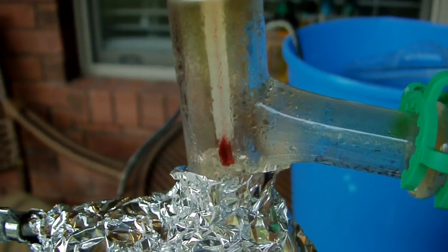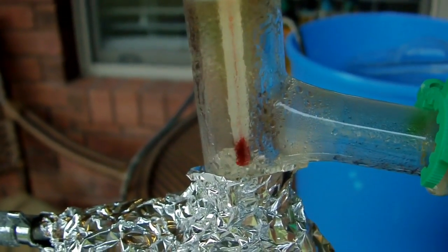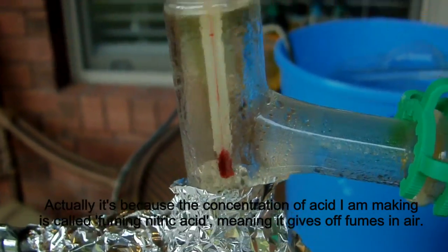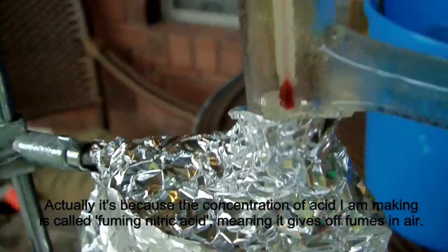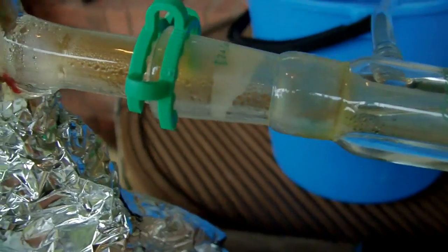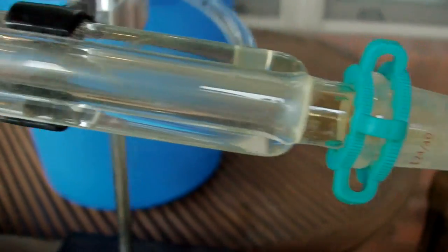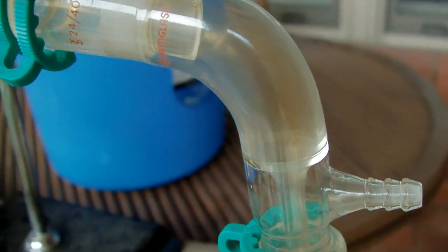And I imagine that's from the decomposing nitric acid, or perhaps other nitrogen oxides. You can see the condensation front has now made its way into the condenser. So we should be receiving our first couple of drops of nitric acid pretty soon.